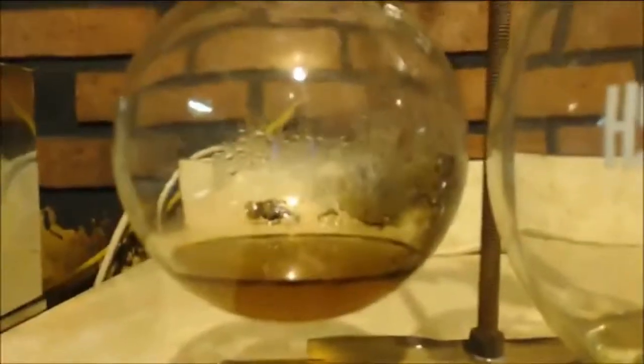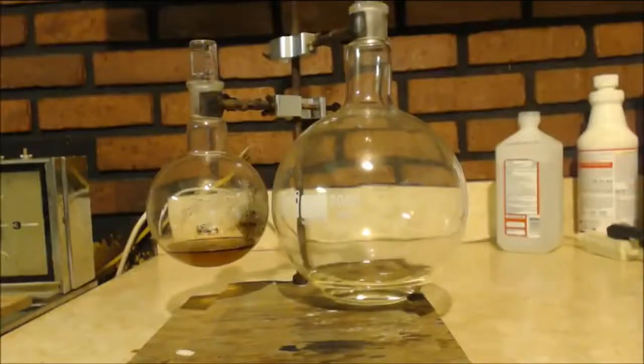Alright, here's the deal. This is the pot. This is what I got. This was the low boiling point stuff. I have to get that at the bottom, see how there's very little. You should never smell chemicals. Yeah, it smells like acetaldehyde.